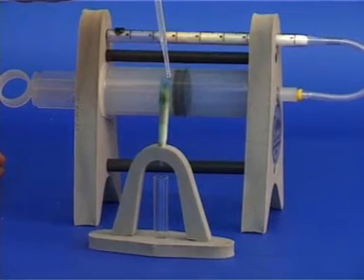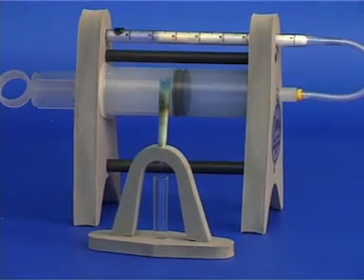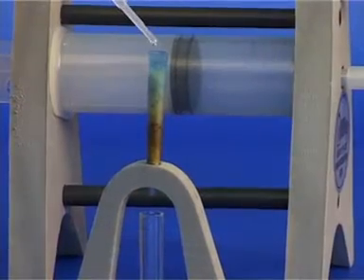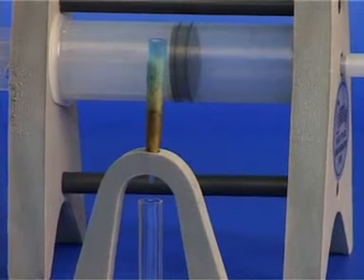Next, using a dropper, add alcohol to the filter and watch how most of the trapped tar from the cigarette concentrates in the test tube.